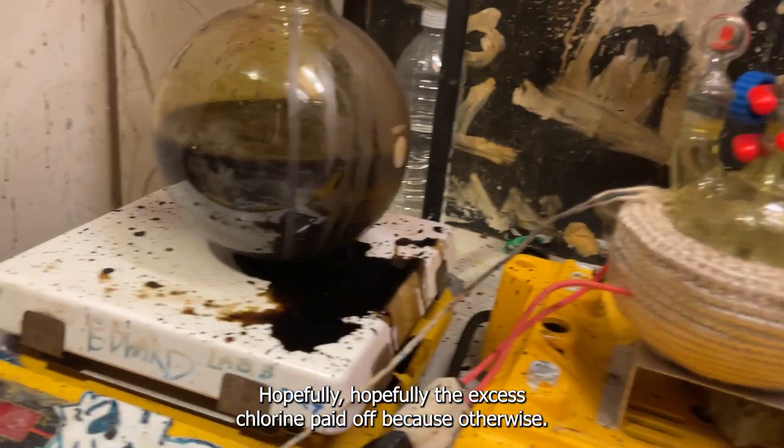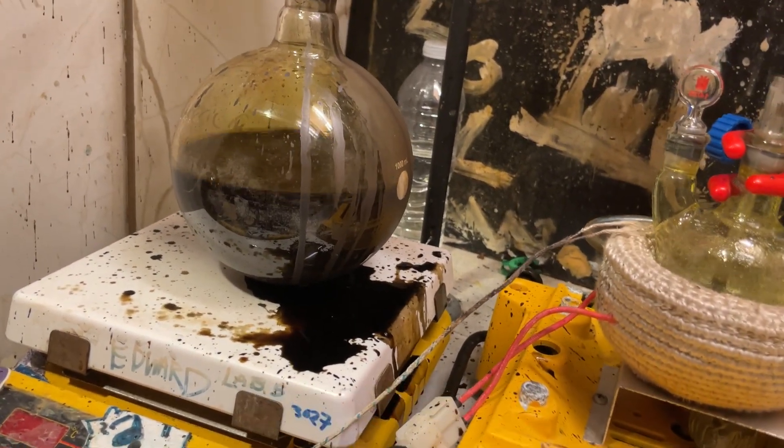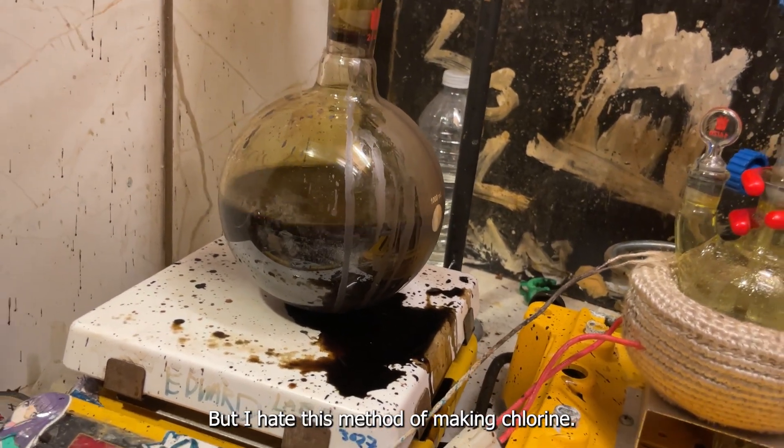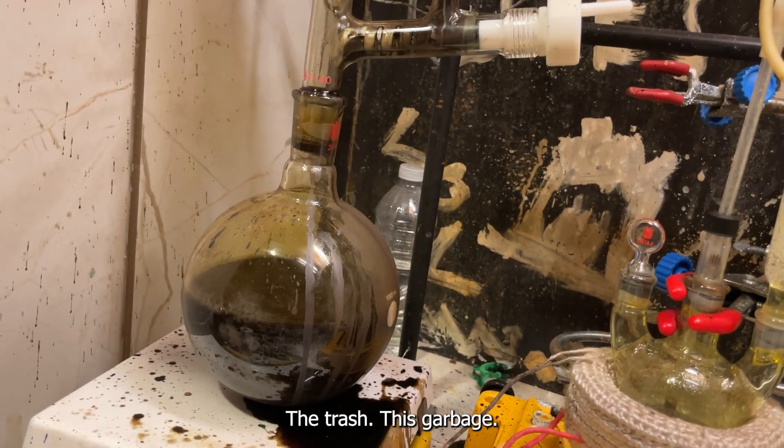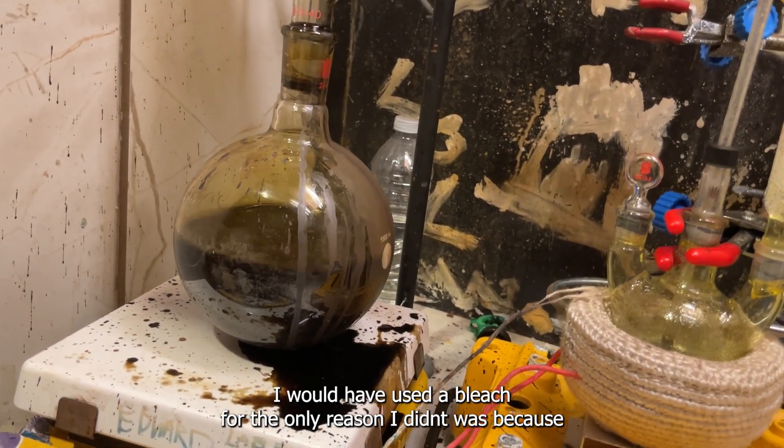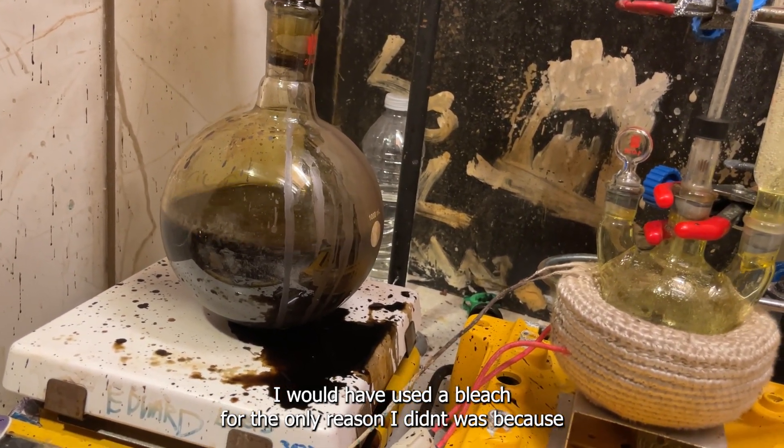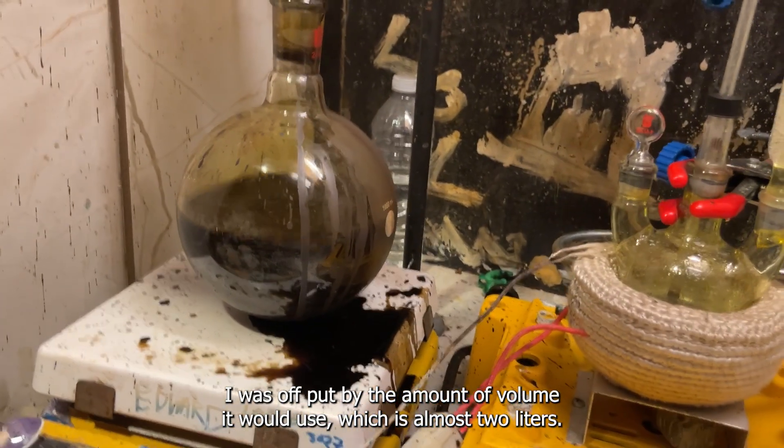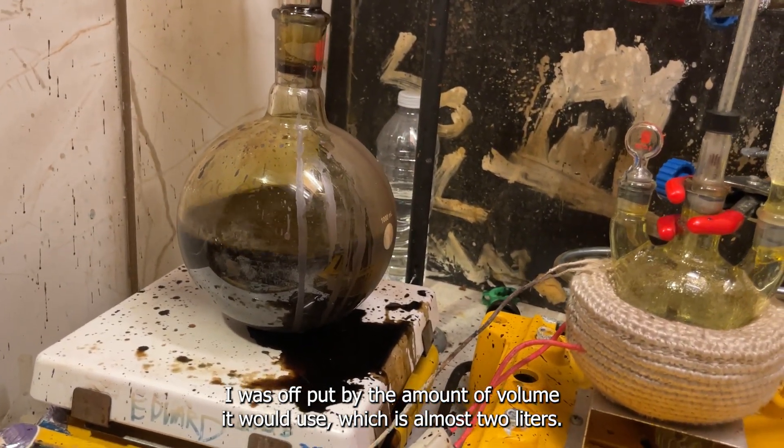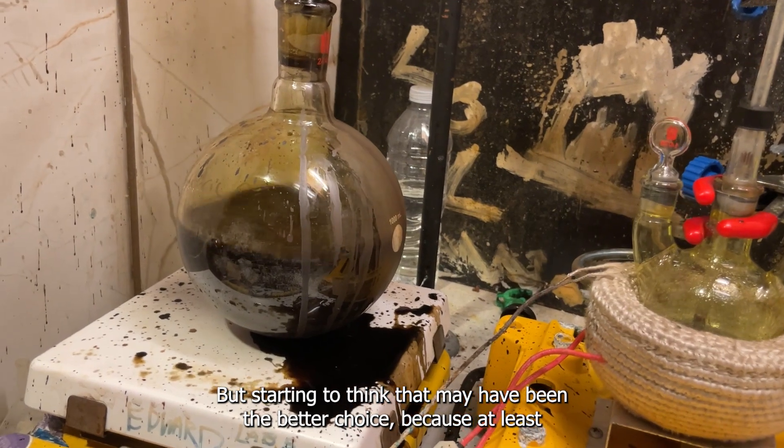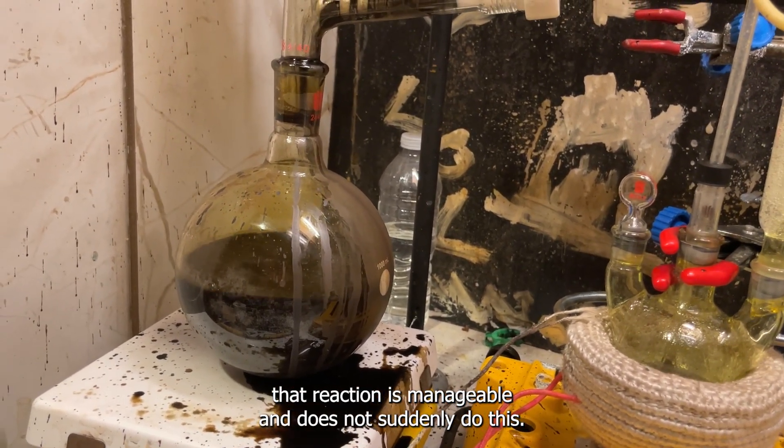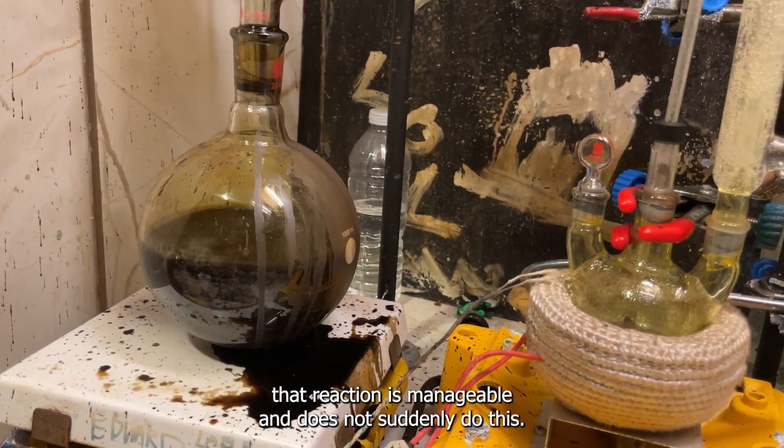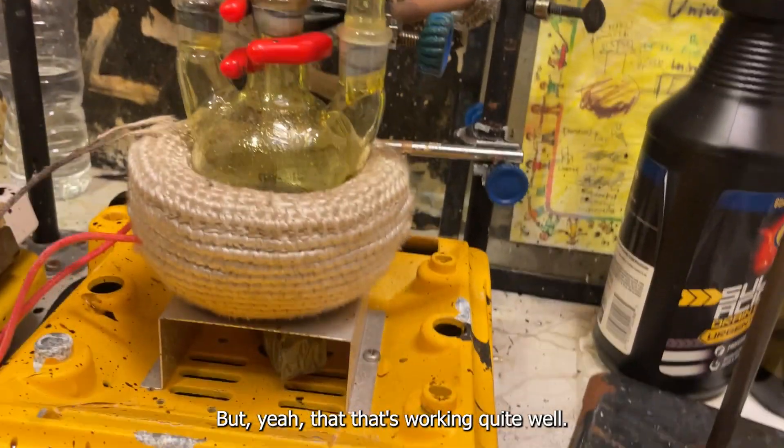Hopefully the excess chlorine paid off because otherwise... I hate this method of making chlorine. Never do it. Never gonna do it again. This is trash. This is garbage. I would have used bleach but the only reason I didn't was because I was off-put by the amount of volume it would use, which is almost two liters. Starting to think that may have been the better choice. Because at least that reaction is manageable and does not suddenly do this.